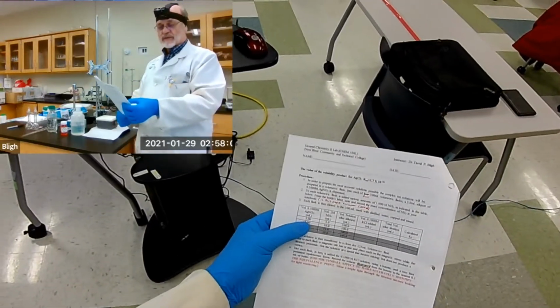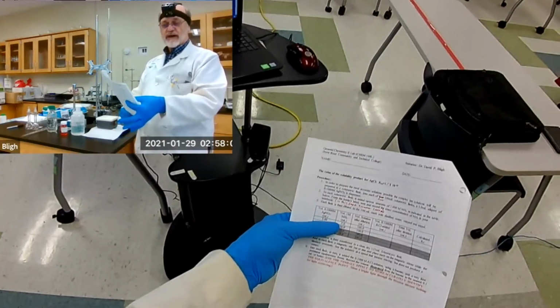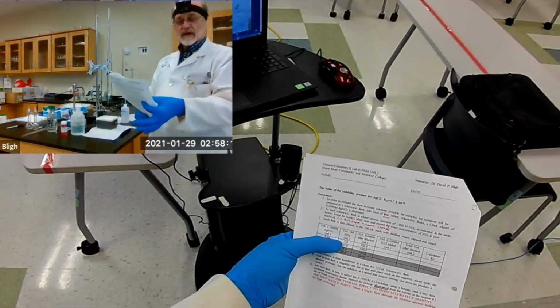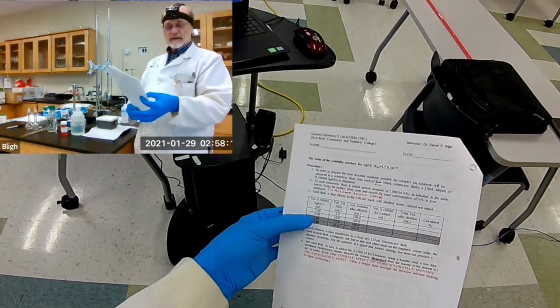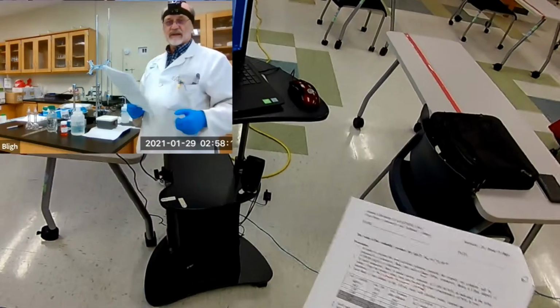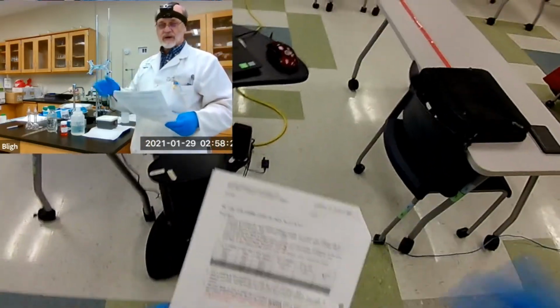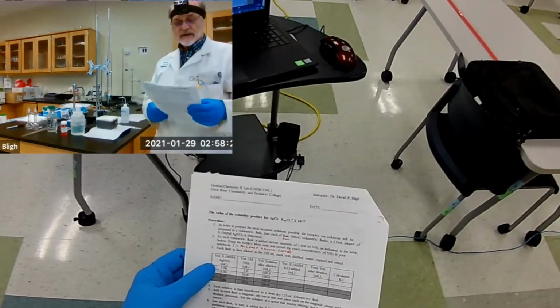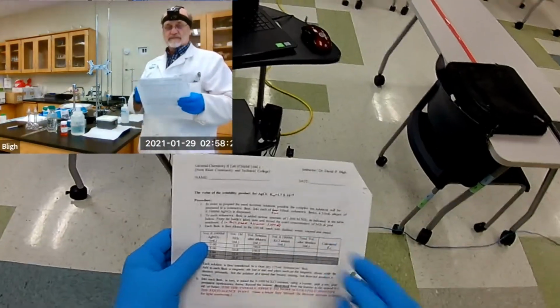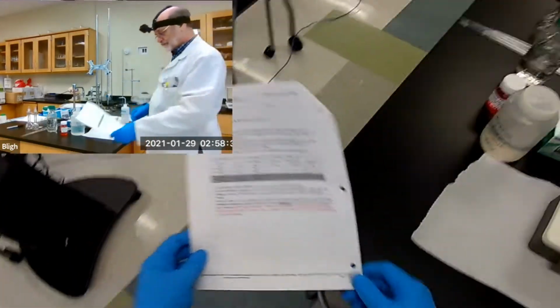So in this method, that would be 5 milliliters of the silver nitrate solution mixed with 5 milliliters of the ammonia solution. We could, if we have time today, do a 5 milliliter and a 10 milliliter. But the titration is difficult and the outcome is pretty iffy. So I'm definitely going to do the first one, the lowest concentration, and we'll see what happens.